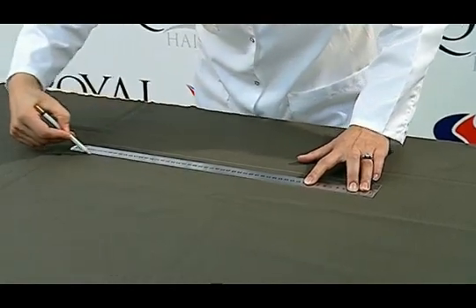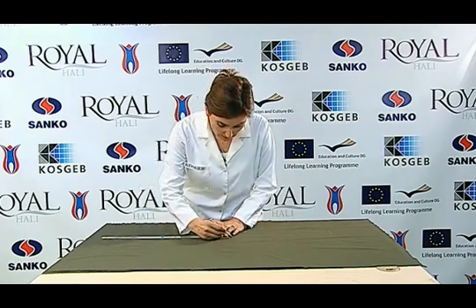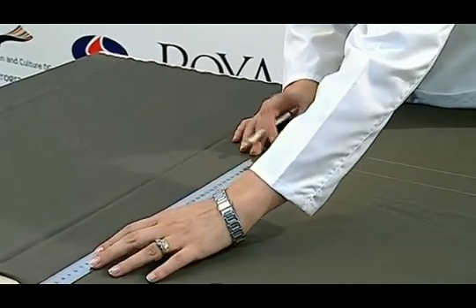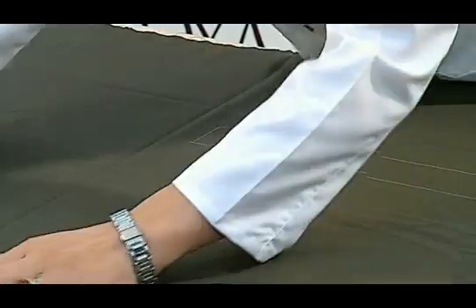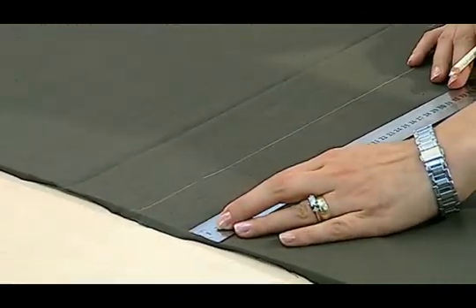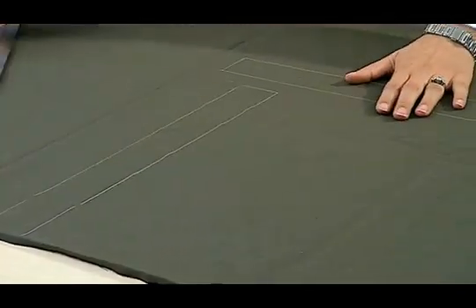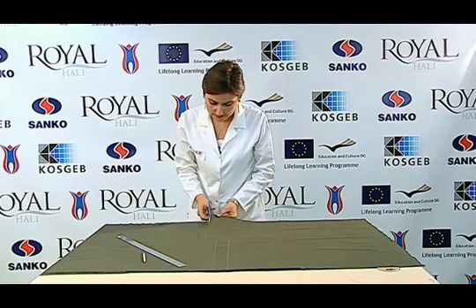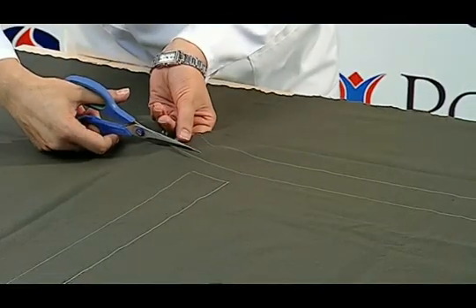Our sample parallel to the weft is used as a weft sample, and the sample whose long edge is parallel to the warp is used as a warp sample. While taking our samples, we mark five samples, each including different weft and warp yarns. Our sample is taken from unwrinkled areas. We cut the sample from the fabric according to the drawn line.